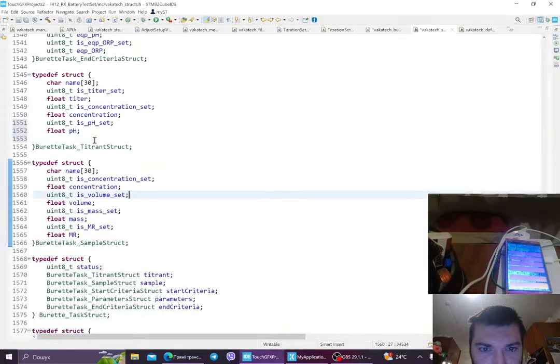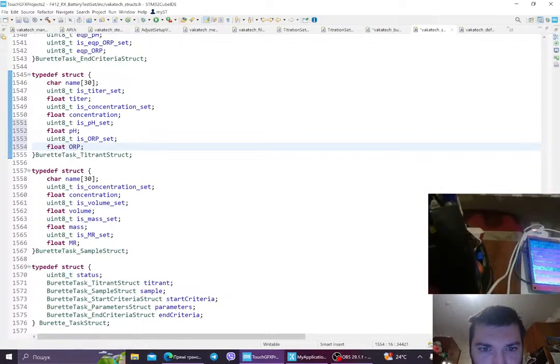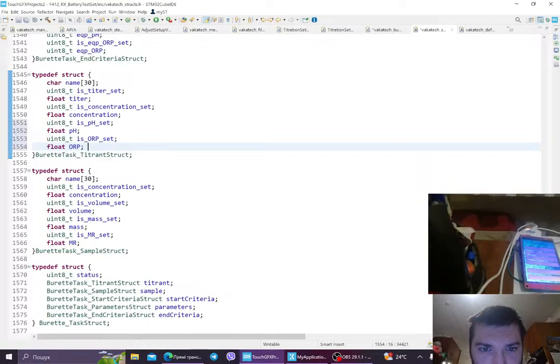So, let's go. We have pH. Of course, we will add an ORP set. No, float ORP. This is nice. Okay, so I changed it.